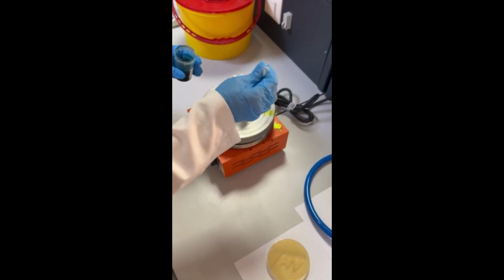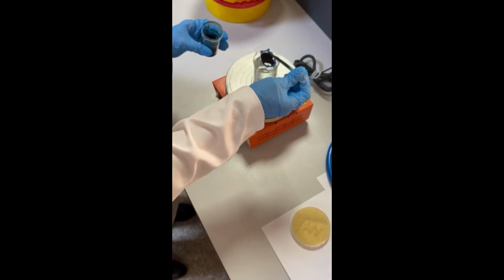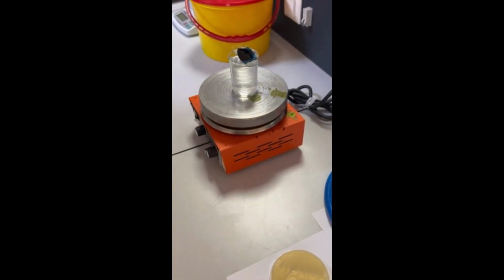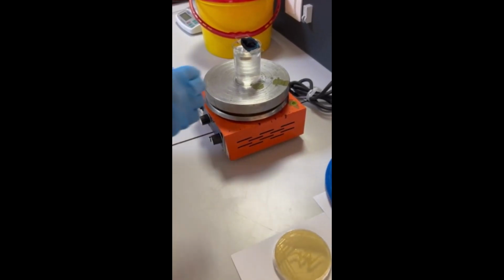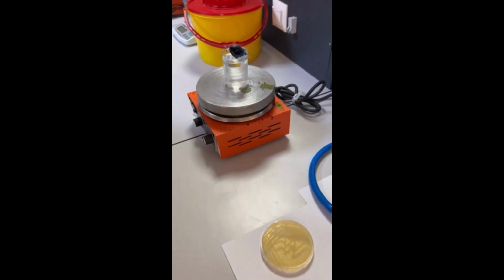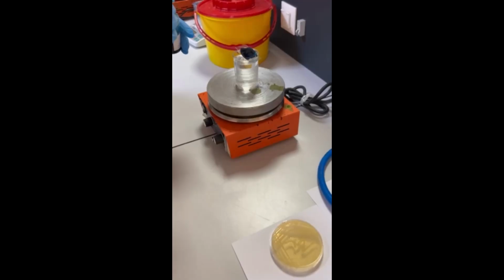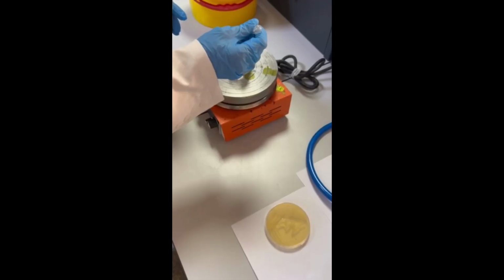This stain dries very easily. Therefore, I put the filter paper to make sure the stain will enter inside the spore. In this step, this slide will be clear and clean. And if the stain dries, we add more stain for about 5 minutes.